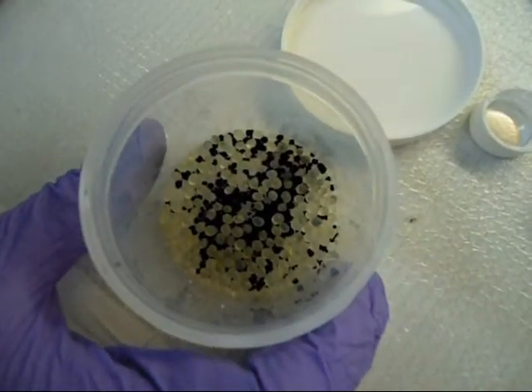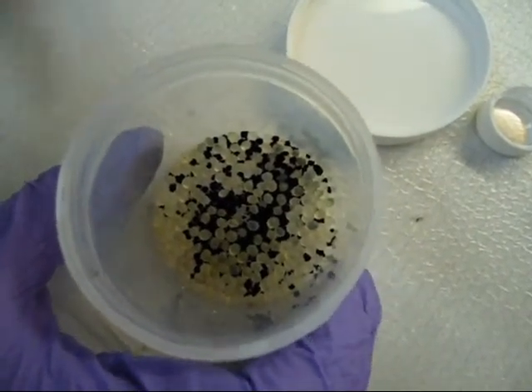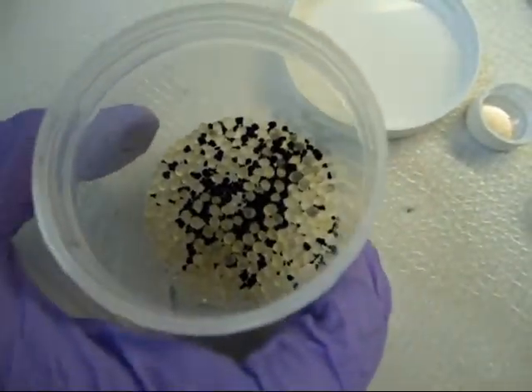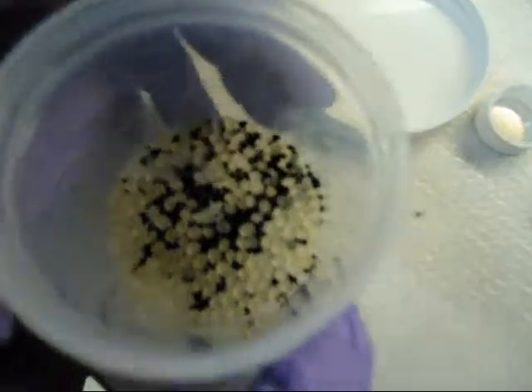Okay, now we have put both graphite and rubber pellets into a container which is made of LDPE. Now we are going to add a solvent.